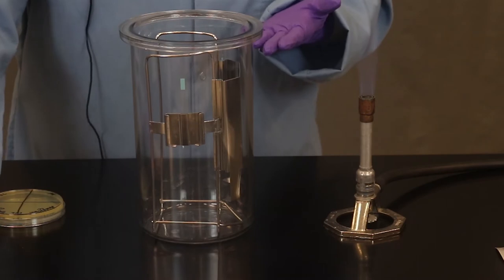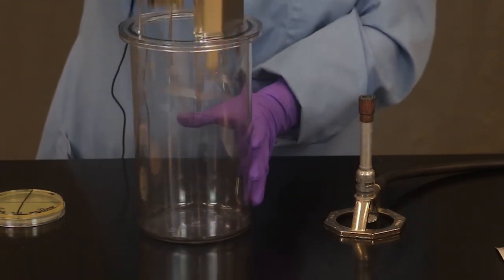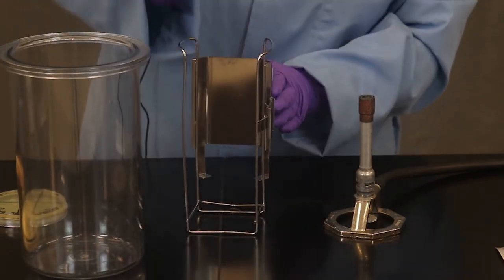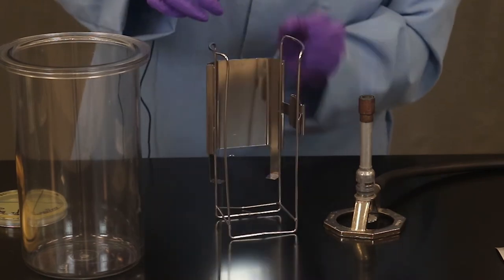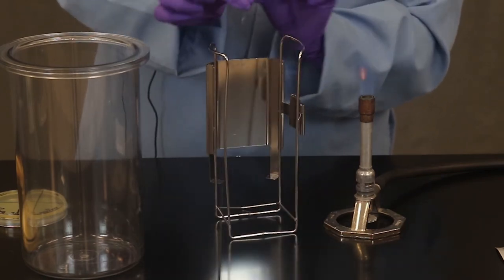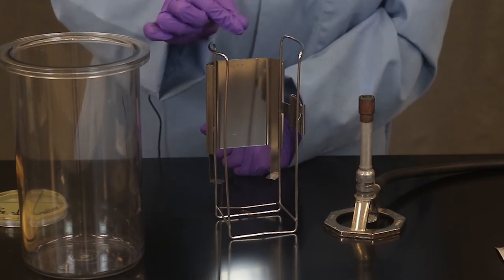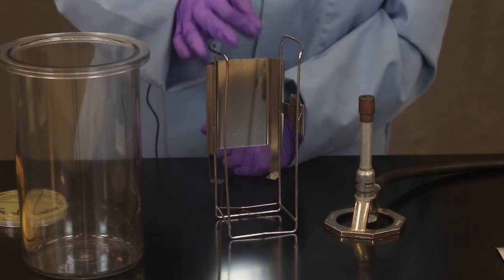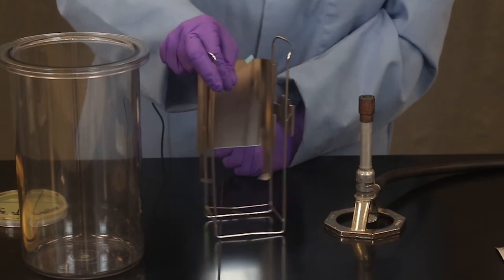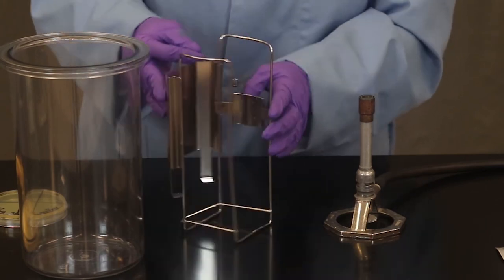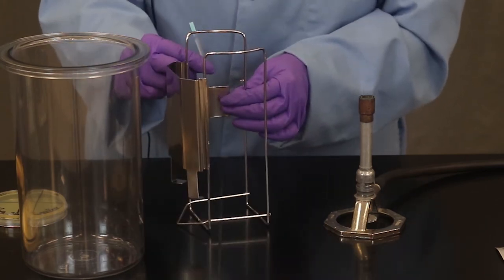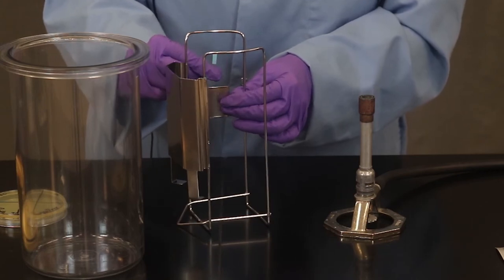So at the end of the experiment you bring this up to your instructor. You'll see a metal rack. And this blue strip here tells us that there's currently oxygen present. And as oxygen becomes depleted in the jar it's going to turn white. So that's just a quick visual that tells us our jar is in the correct anaerobic condition. And that does take a few minutes to occur.